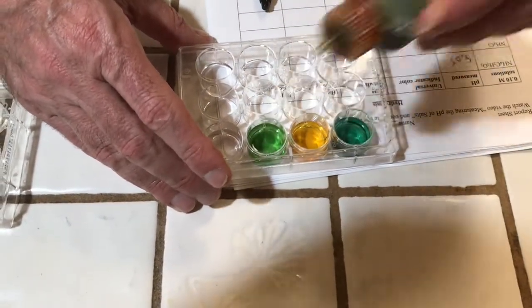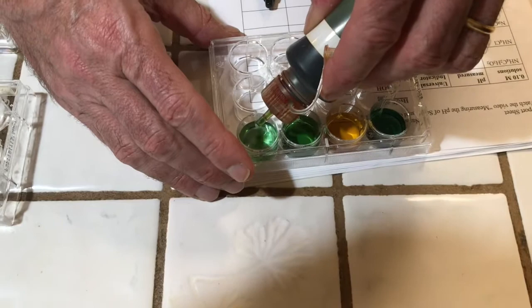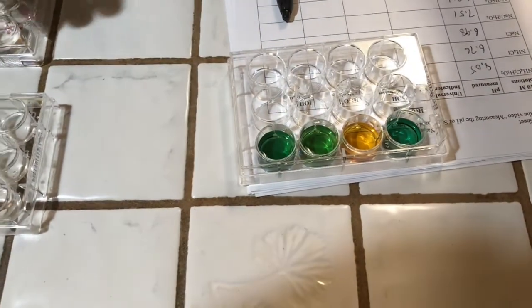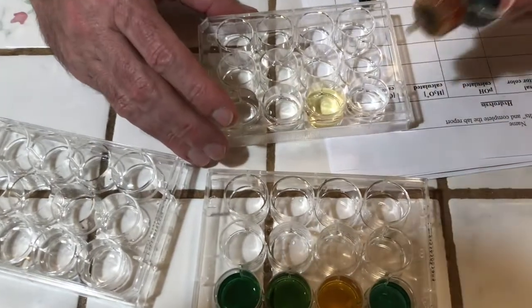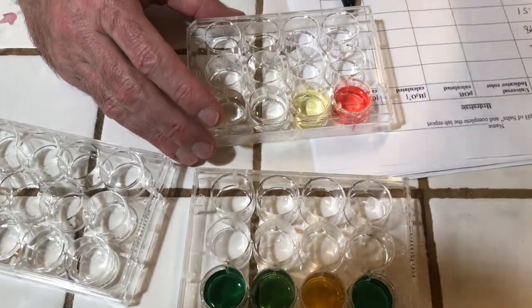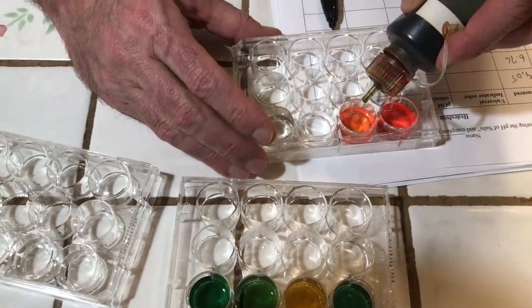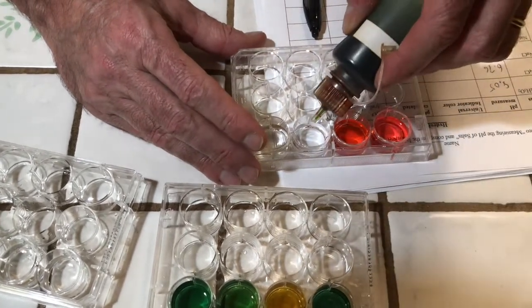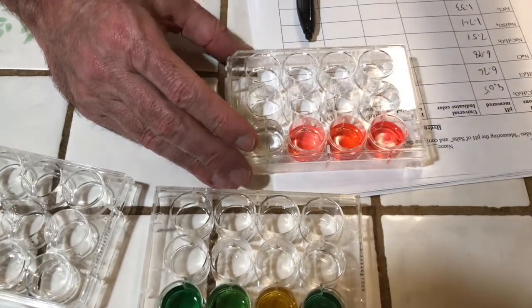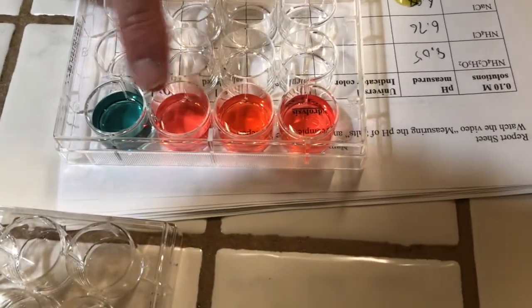This is sodium chloride. This is sodium acetate. Next we have sodium bisulfate. Ferric chloride. Now the yellow is going to mask things, but you can see it's still red, acidic. Sodium dihydrogen phosphate. And sodium monohydrogen phosphate. So changing one hydrogen makes a big difference.